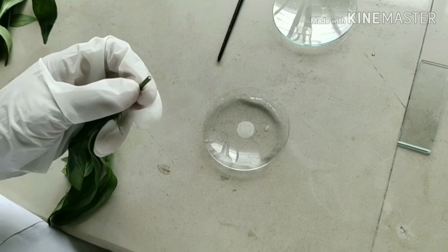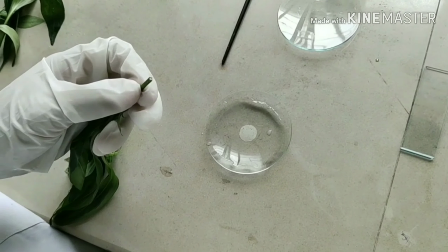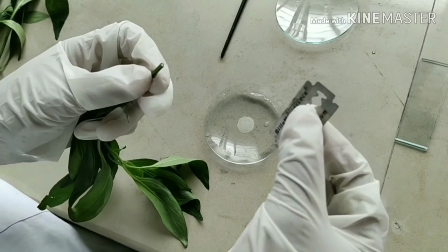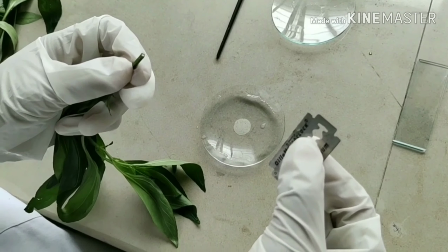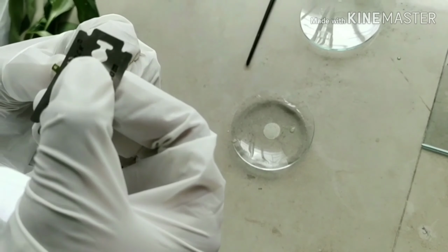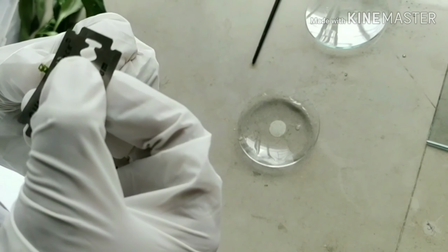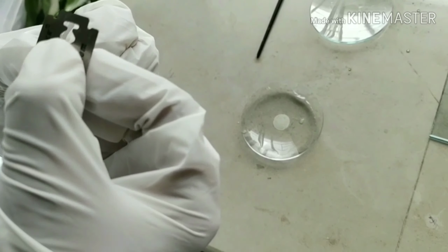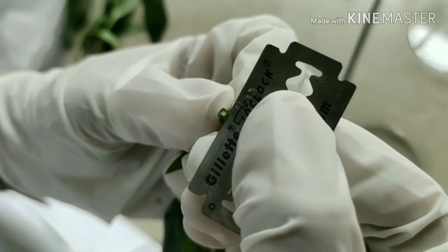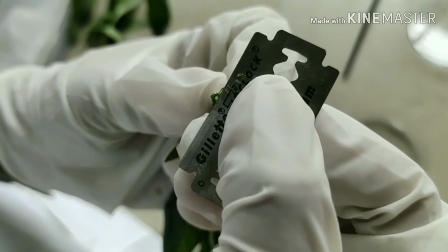For transverse section, the material to be studied is held up in 2 fingers of the left hand. A sharp blade is held up in the first 2 fingers of the right hand. The crude drug is dipped in the water and then cut with desired size to prevent entry of air. The material in the left hand is held up straight and then cut with the blade passing through the radius. However, the sections are cut at similar rhythm.